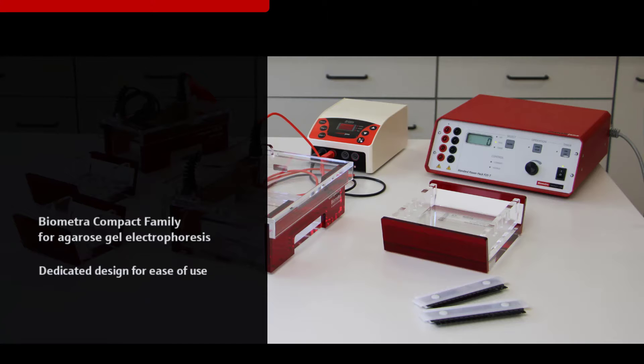The XS, S, and M systems for small to medium-sized gels offer particular simplicity when pouring gels.